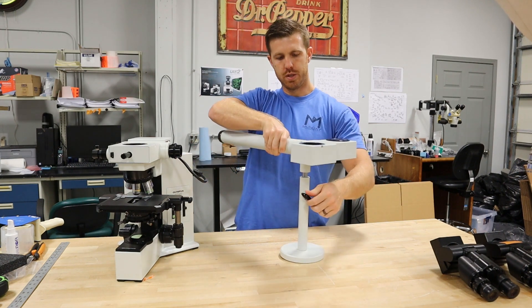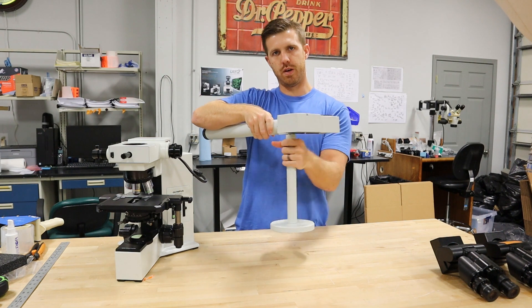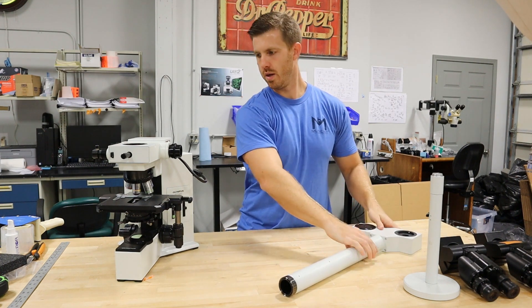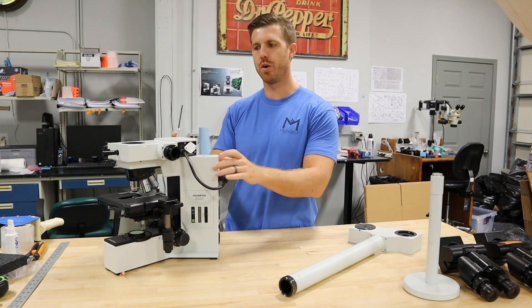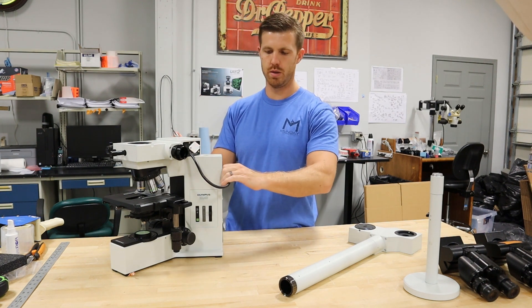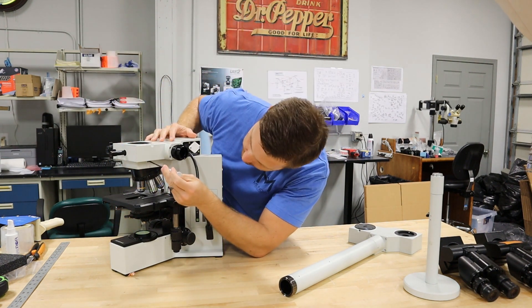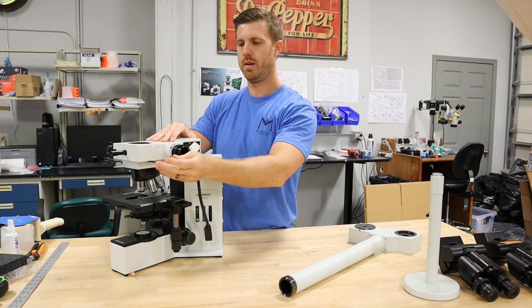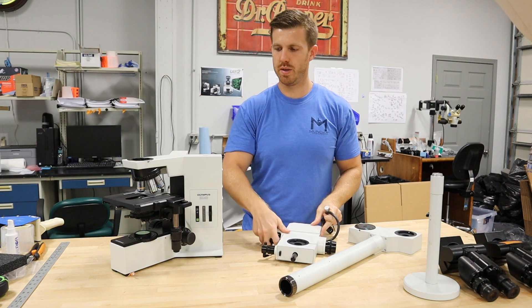This post usually has a black dovetail screw. Lock it back down and that screws right out. Once that's disassembled, this BX40 will plug in the back. A BX40 or a newer model, an LED one, will have an LED pointer power supply that'll go into the side. Make sure that's unplugged. Unplug the item, use your Allen wrench, and the splitter will come off the dovetail. Now it's disassembled and we'll put it back together.